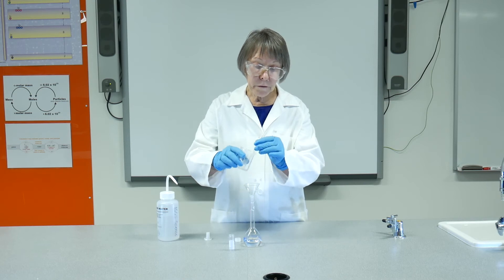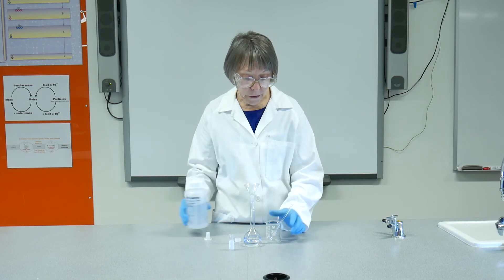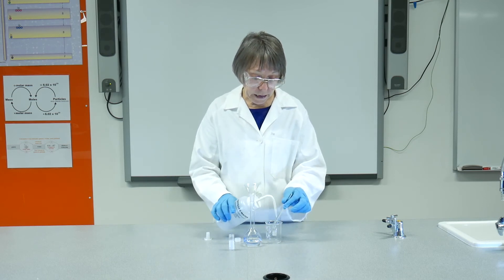Now that we've got the bulk of it in there, we need to make sure that we are going to rinse this completely, so that there is none of that acid left in the beaker.